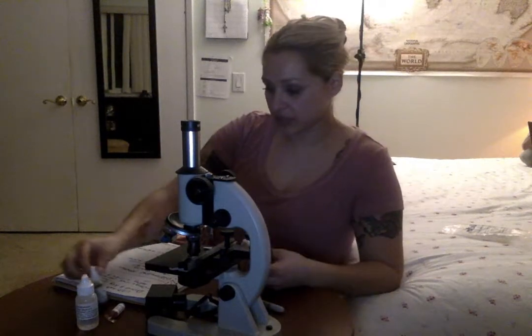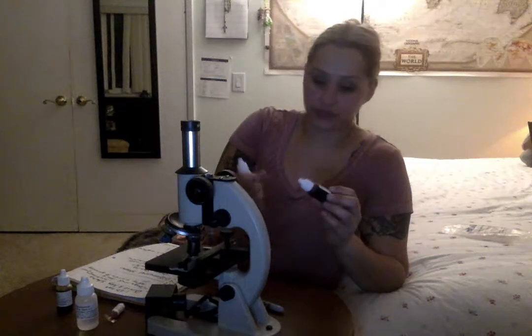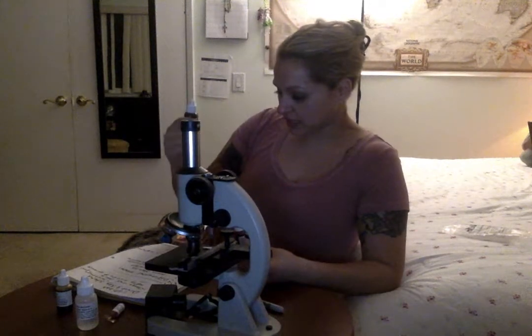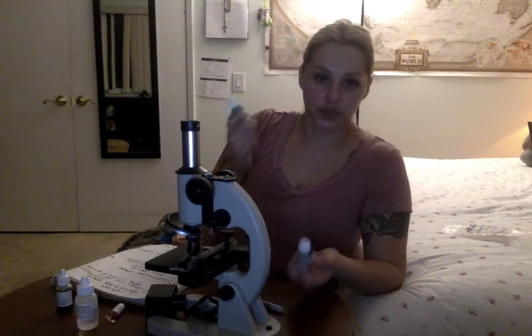The difference between all these is, well, these are the two main differences. The crystal violet is going to pick up on the cells, so it's going to get all these little tiny structures. This one stains the gram-positive ones, and the red one, the safranin, stains the gram-negative ones. So these ones will stain pinkish, whereas these ones will stain more violet.